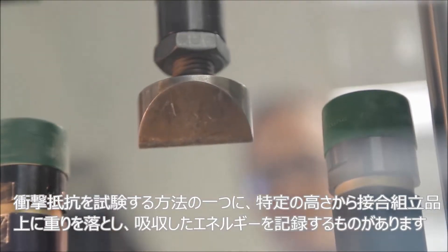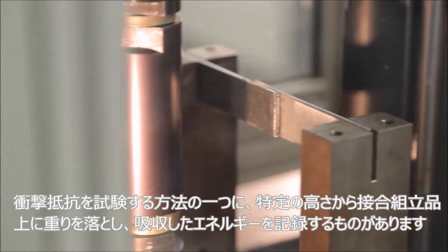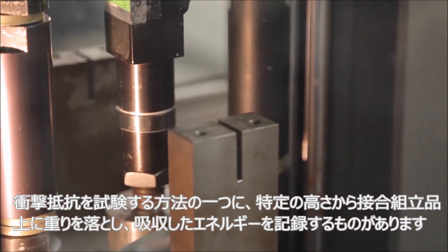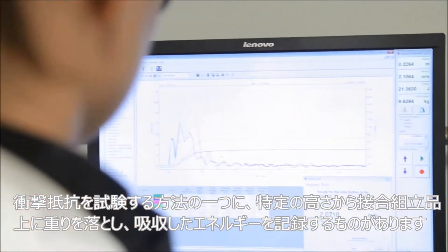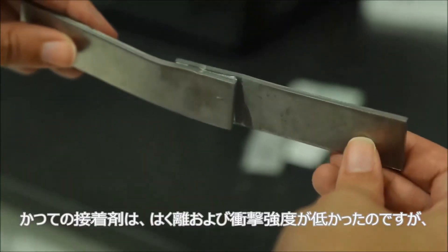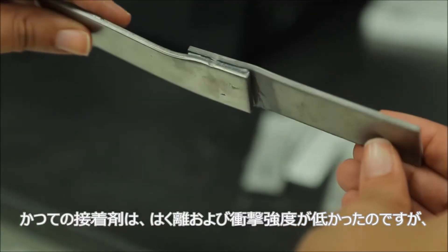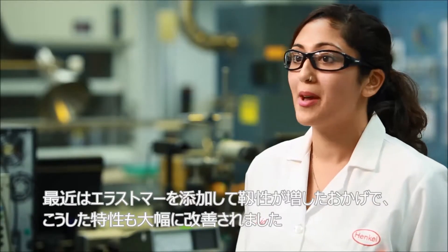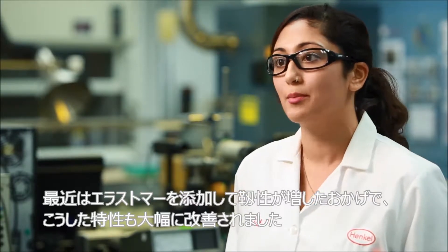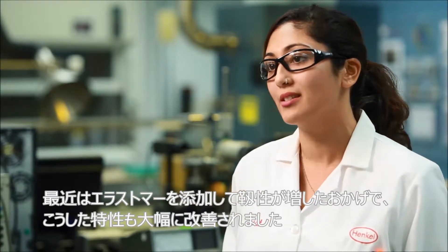One way to test for impact resistance is to drop a weight from a set height onto a bonded assembly and then record the absorbed energy. Adhesives which in the past had low peel and impact strength can now be toughened with elastomers, resulting in substantial improvement to these properties.